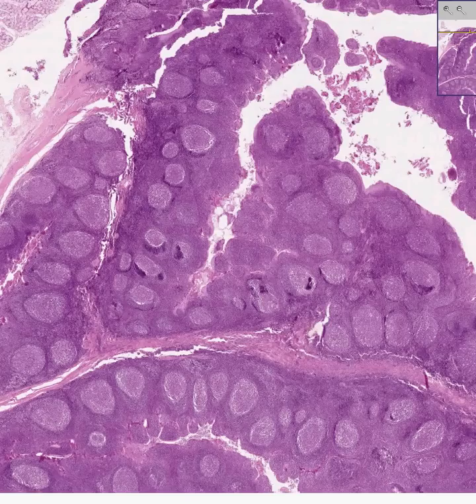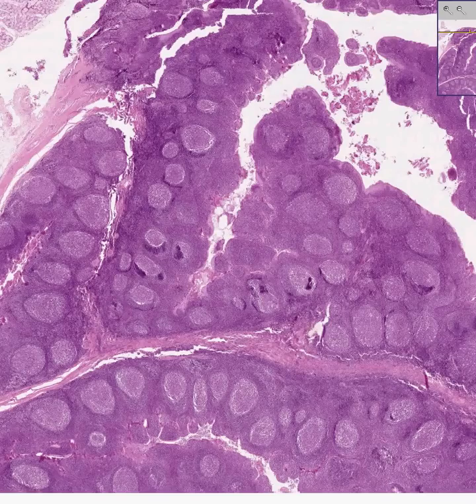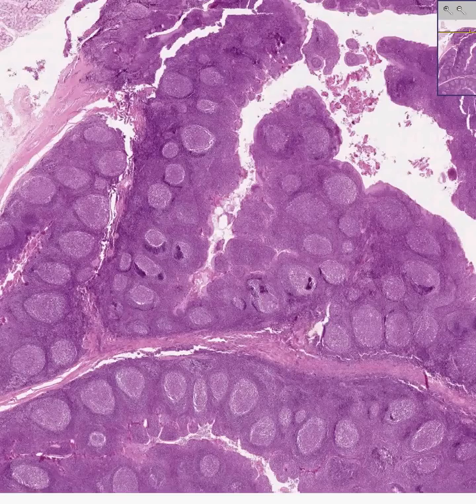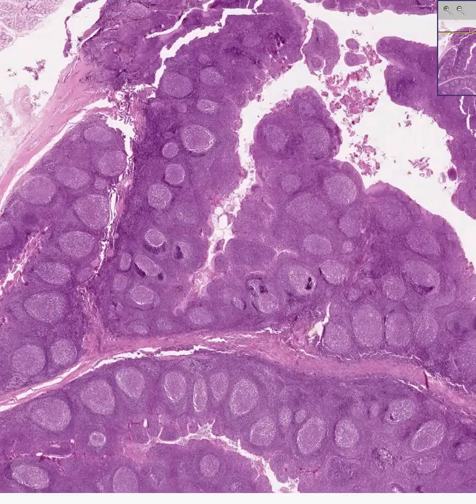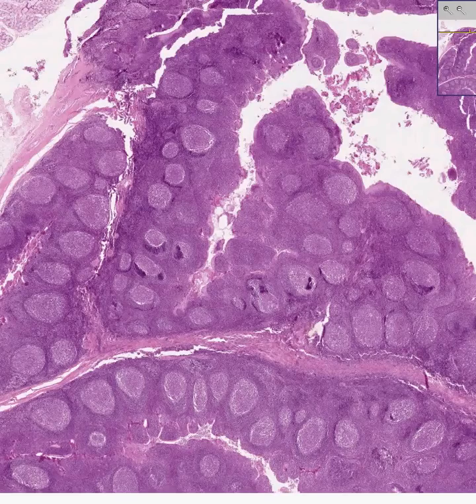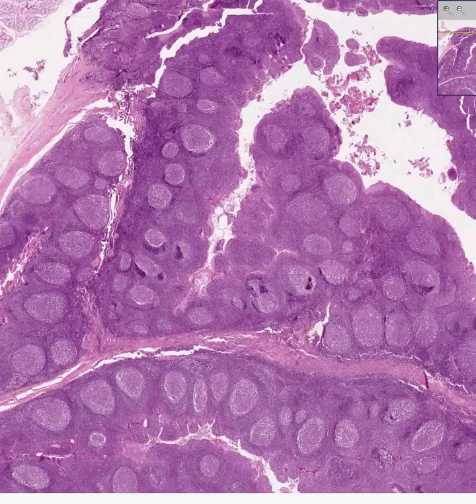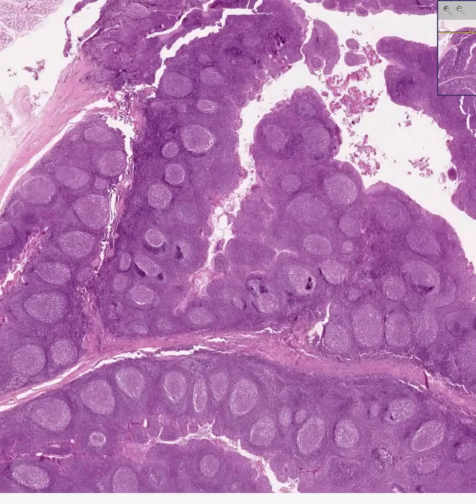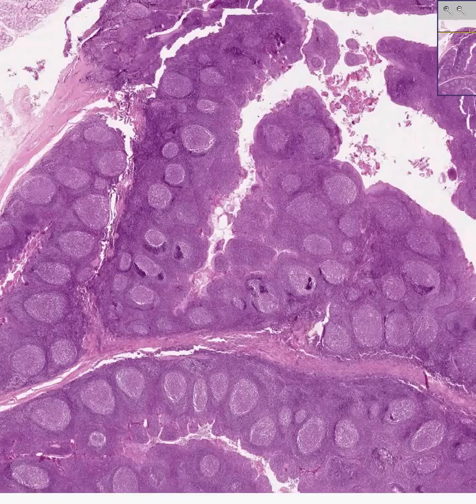In some areas, the MALT or mucosal lymphoid tissue is differentiated enough to form grossly recognizable organs or excrescences, and these are called tonsils.